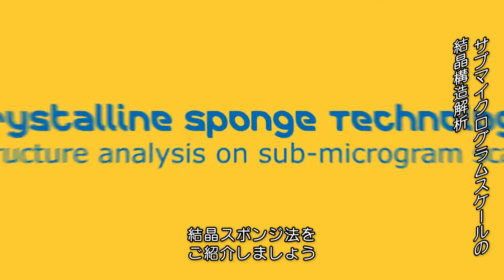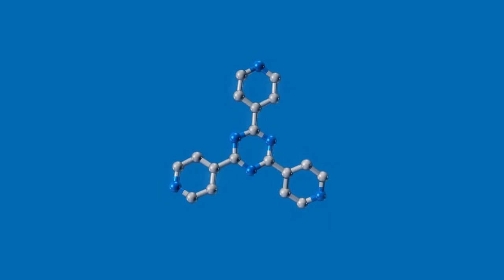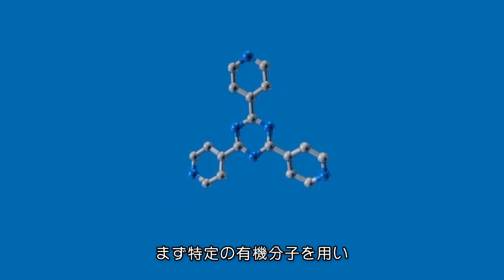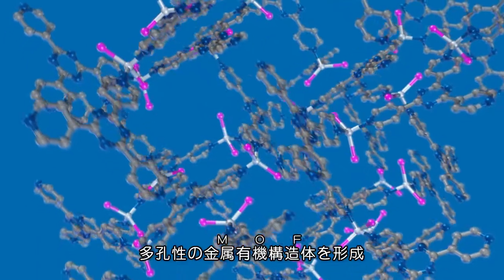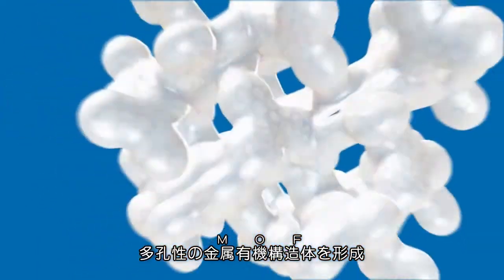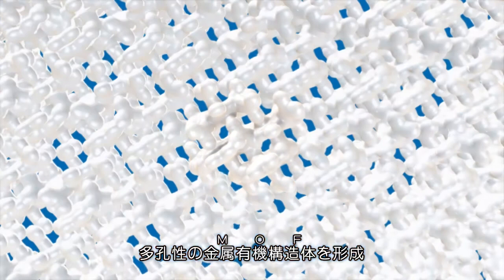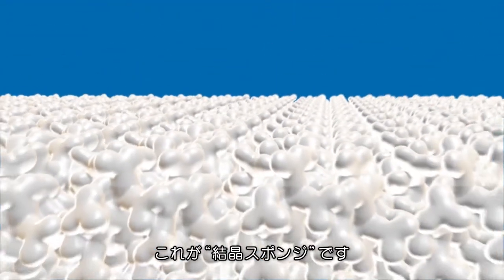Curious to learn more about the crystalline sponge technology? By using a specific organic molecule, we can form a highly porous metal-organic framework, which is called crystalline sponge.